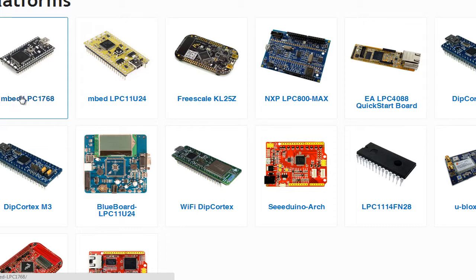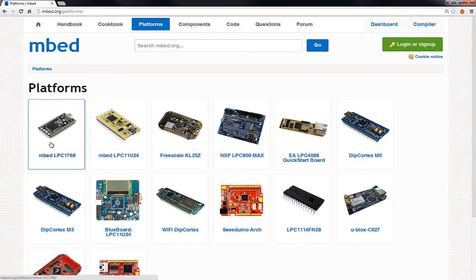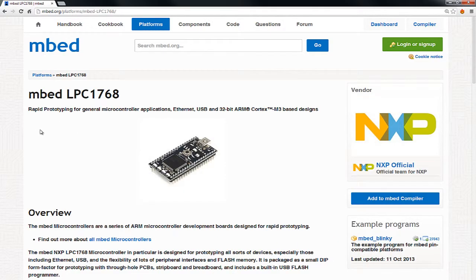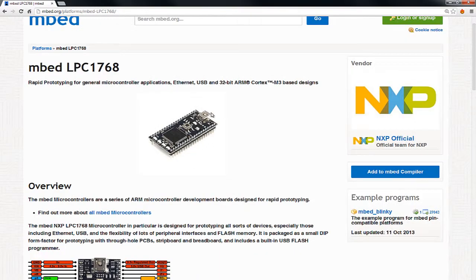The difference is that it's very powerful. It's much more powerful than your Arduino system, and it gives you a lot more to play with. Since its introduction, there have been a lot of other platforms, but we're using the LPC1768. When you look at the Chem control box, you'll see this device plugged in. It exposes a bunch of the I/O we use out to header pins, so it's socketed on the board, and everything happens programming-wise over this USB port.